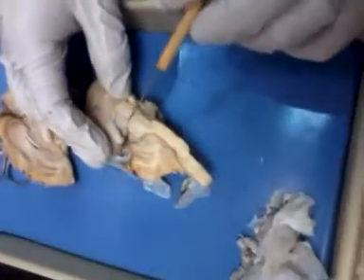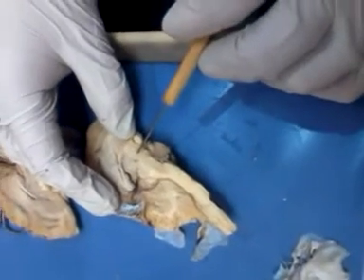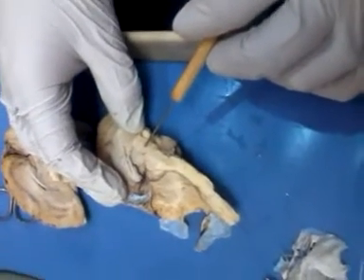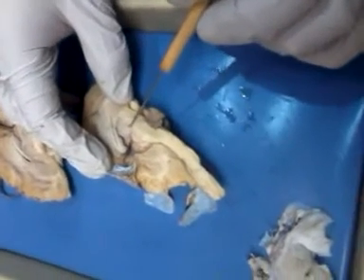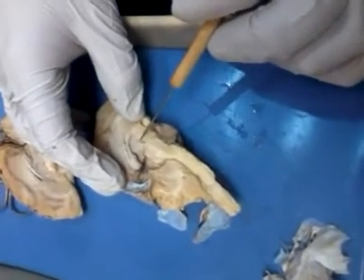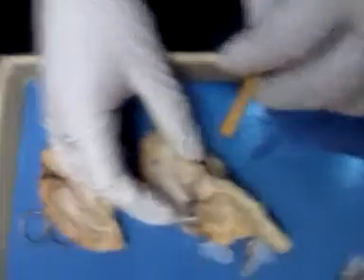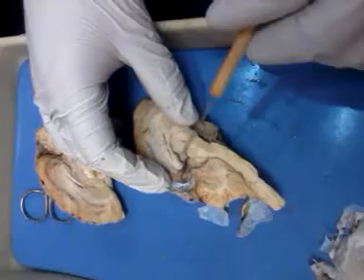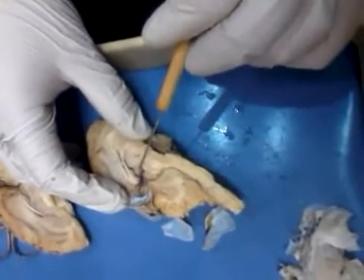Okay. Sorry. So then here you've got your thalamus, and down towards the bottom is hypothalamus. Like I was telling them, one of the terms is intermediate mass. It's like a little spot in the middle of your thalamus that you can't see on here. Okay. Then right back here, see this little guy? Right to the back of the thalamus, that's your pineal gland in the epithalamus.